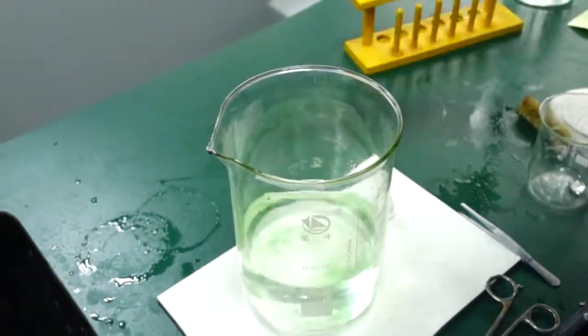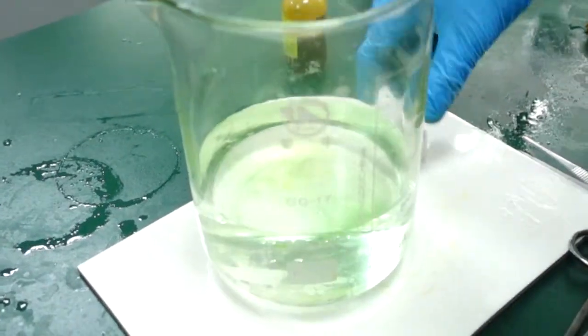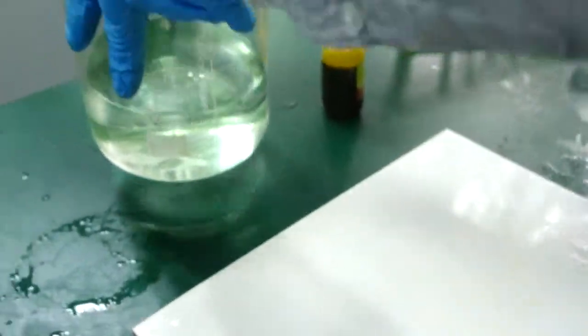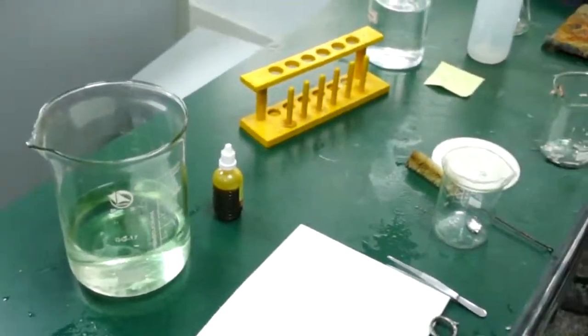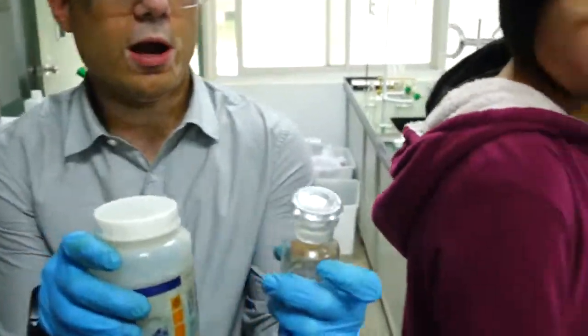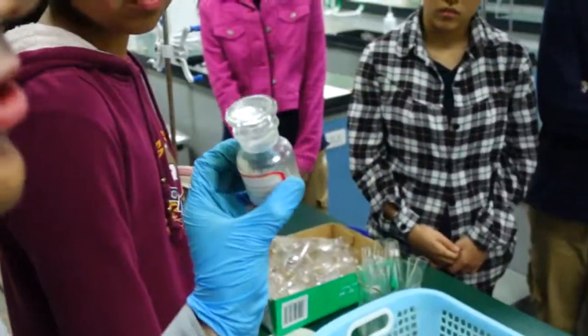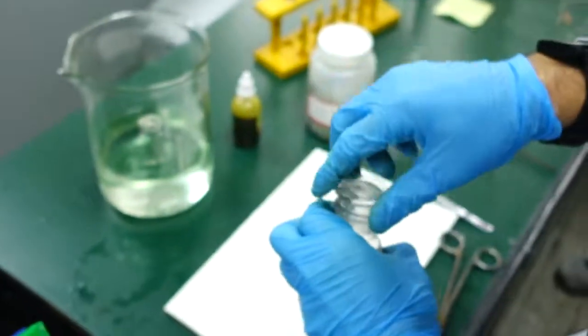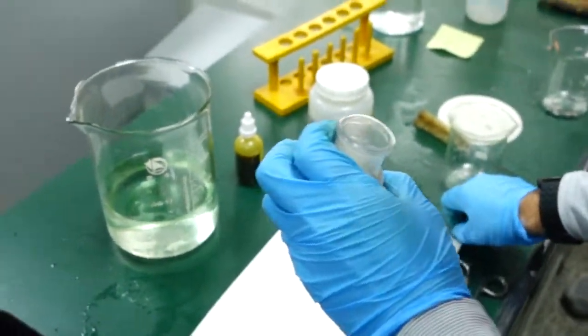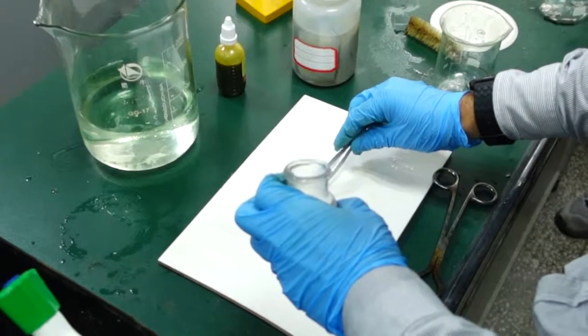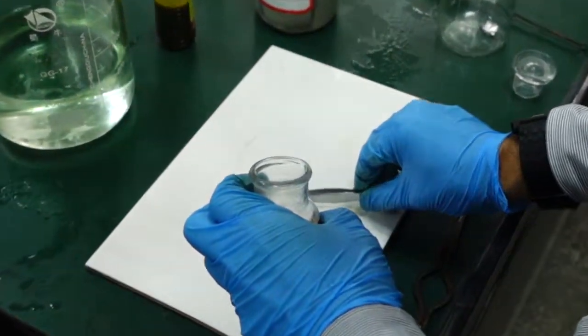Now I'm going to add two different metals. I need to get them first - X and Y. You see, X and Y are stored under mineral oil because they react just with oxygen from the air. That's why we have them underneath oil. Unfortunately I don't have any tissue to clean it, so I'm just going to have to put it in with the oil still on it.